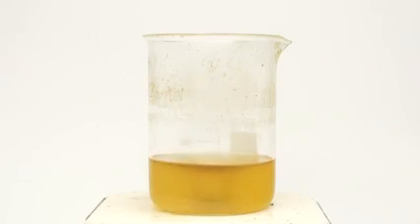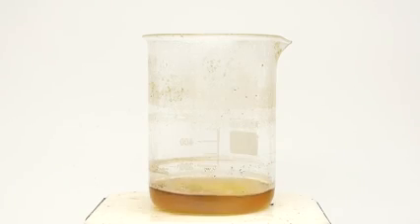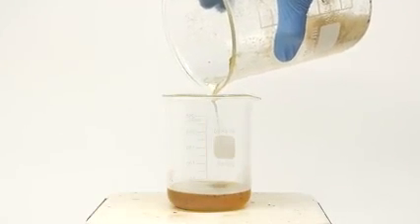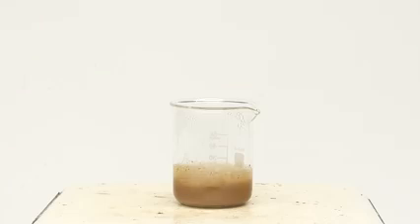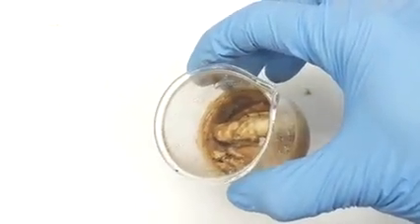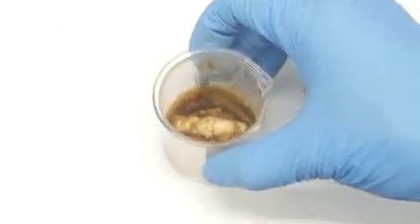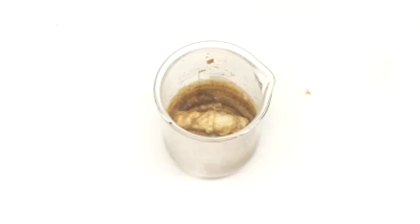If I were doing this with homemade olive oil soap, the water would also contain glycerol. However, because it's a commercial soap, the glycerol has been removed. Just to confirm this, I boiled down all of the water, and I was left with just some dirty sodium chloride. When I first started this project, I was really hoping that the glycerol would just magically still be in there, even though it's not listed on the ingredients. The idea of isolating both the glycerol and the fatty acids from the soap, and then recombining them to make the oil, seemed really cool to me, but unfortunately, I'm gonna have to use store-bought glycerol.